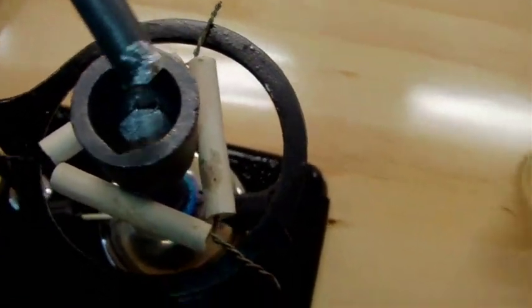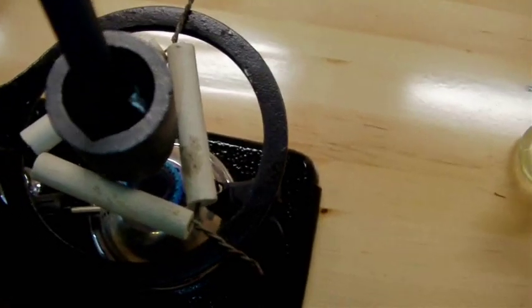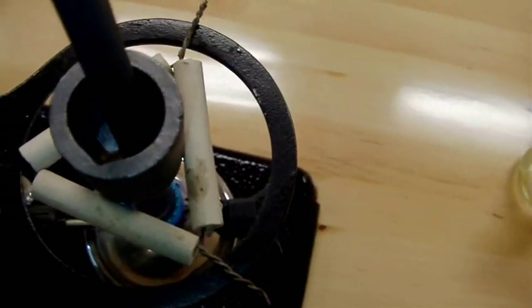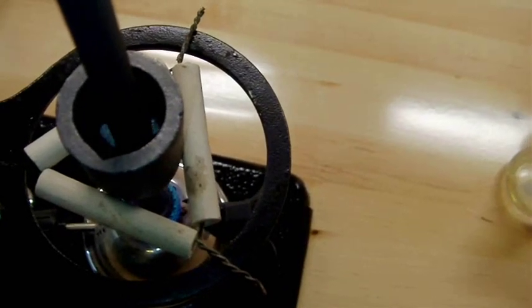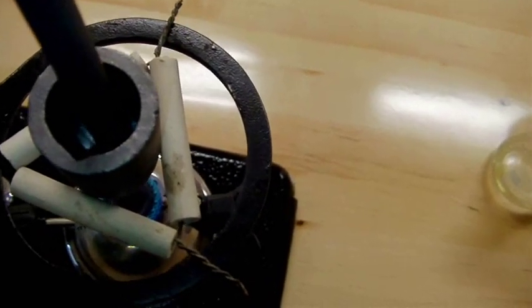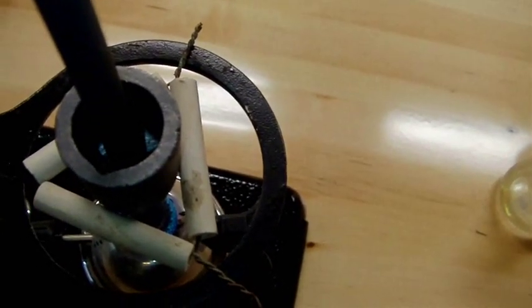You can see it sticks to the rod because the rod is cool. So I'll let that heat up to the temperature of the melt. So as I said, this shouldn't take very long at all to do just because it's low temperature.